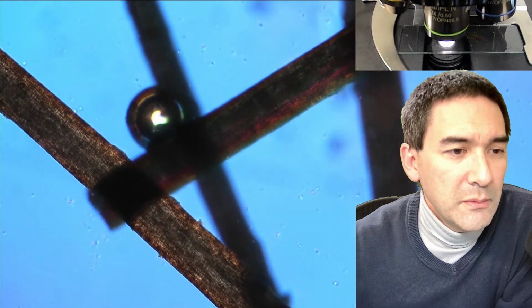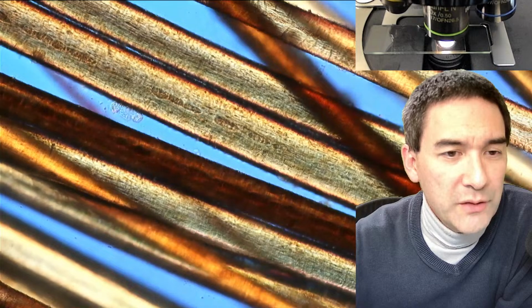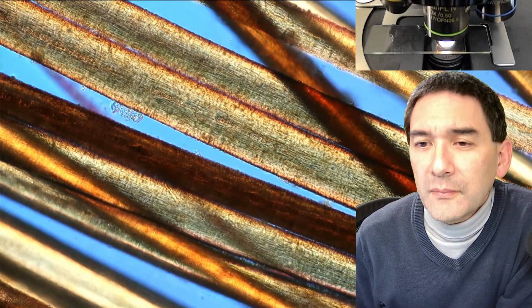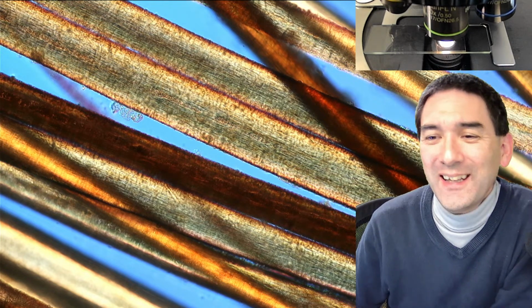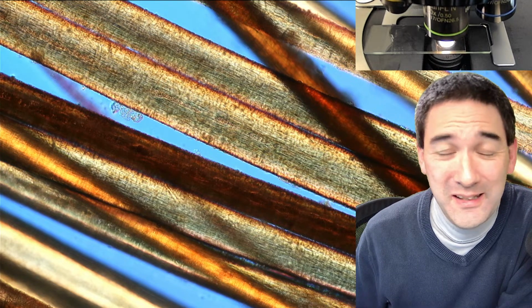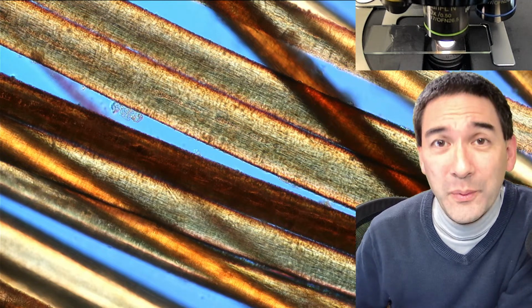Okay, some air bubbles, and in comparison again, this is the one that I left in hydrogen peroxide for a couple of hours. My professor once said reactive oxygen species like H2O2 react with everything they should not react with. To this day, I love this quote. That's the thing, H2O2 is very aggressive. It's unstable, obviously, and it really likes to react with organic substances.